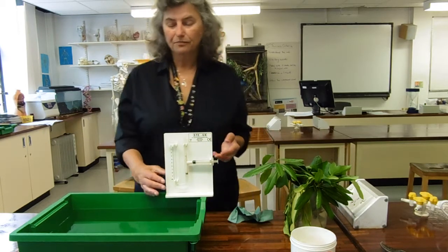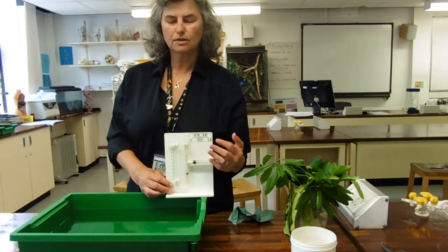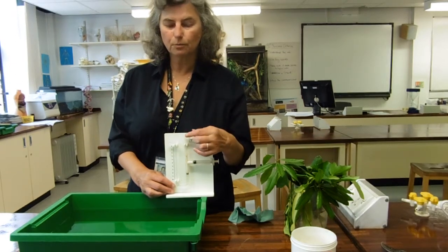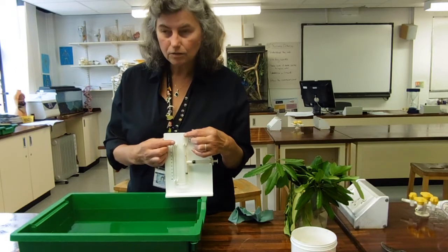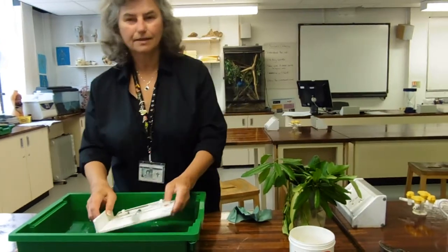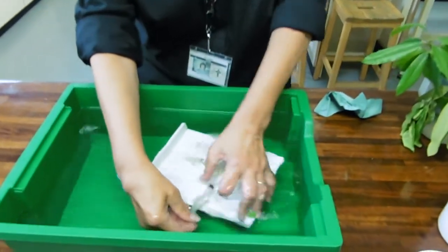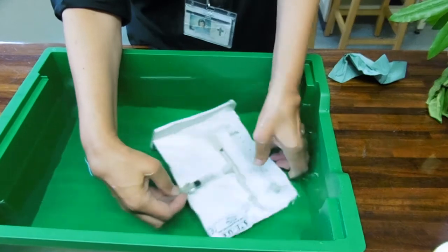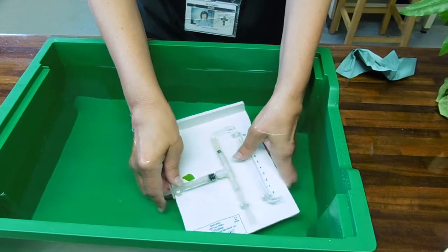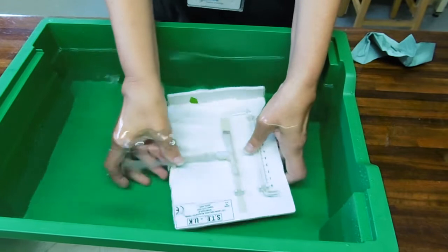Setting up then: we're going to fill all of the system with water. Now that's really, really important — that it's all full of water, so that the column of water between your plant and your scale is completely unbroken. They are a bit fiddly to set up, but effectively I'm immersing it in a tank full of water, pushing water through and sucking it up.